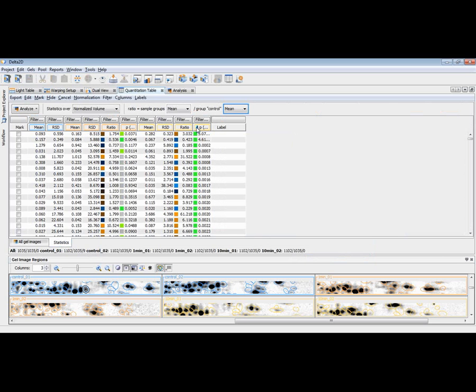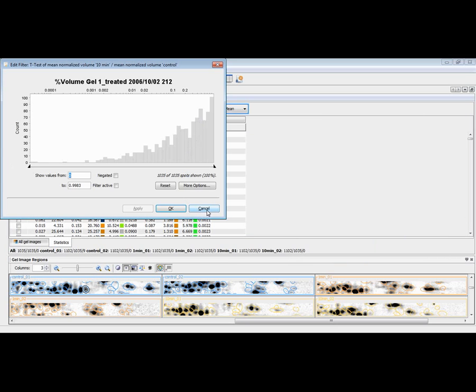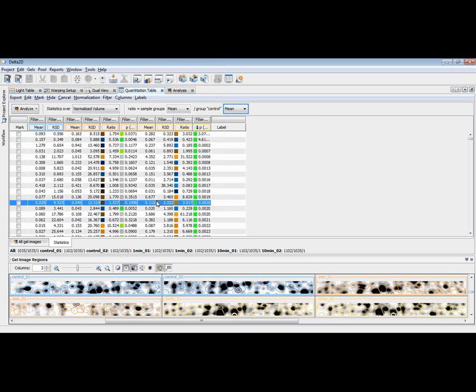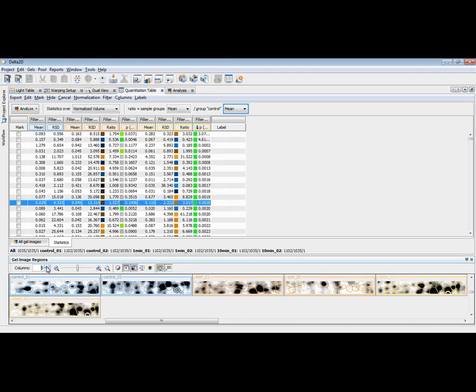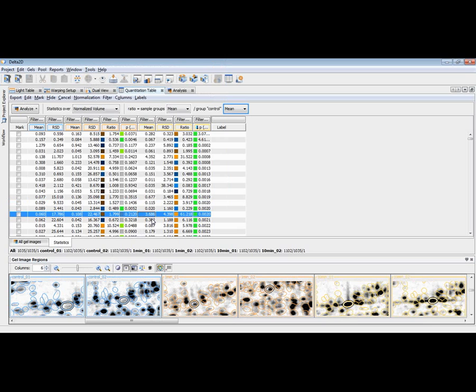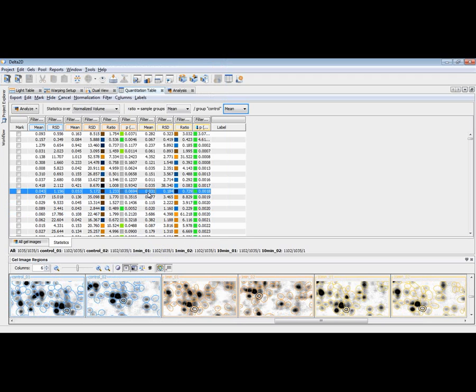Click on the head of this column to sort the column by this attribute. You can also invoke filters to then find interesting expression profiles. You can click a certain line, a certain expression profile, and then see this spot across all the different images and review whether this is a real spot signal or whether you should maybe exclude this from your further analysis. Like this.